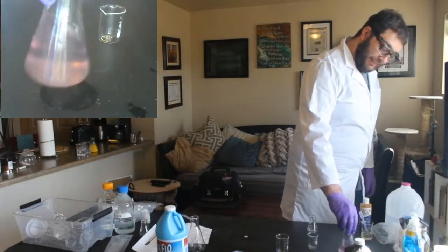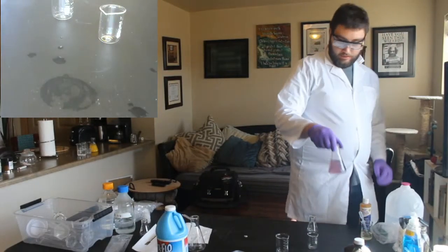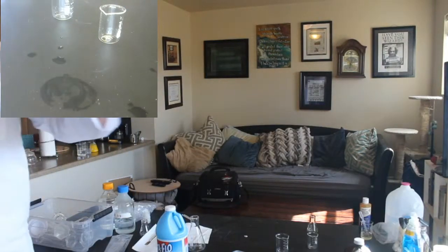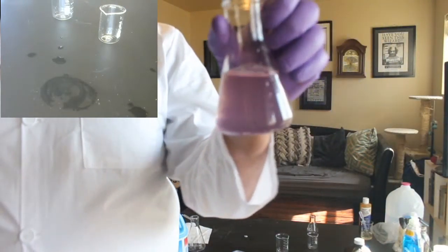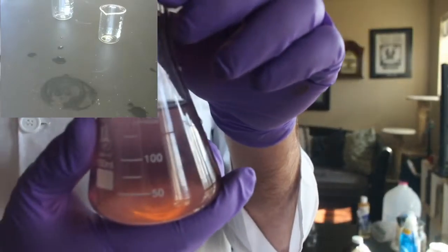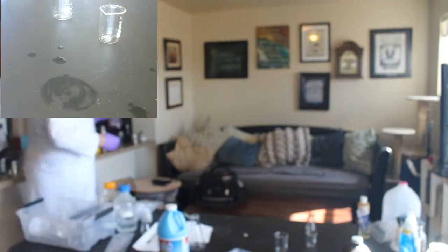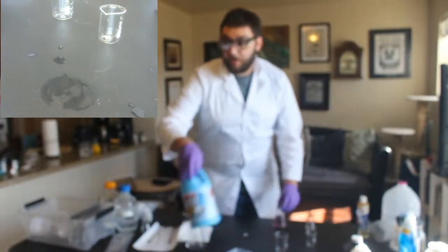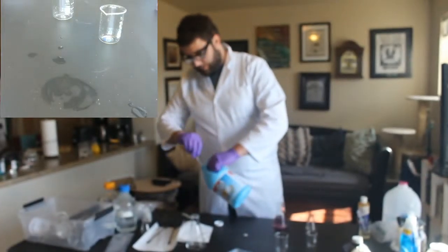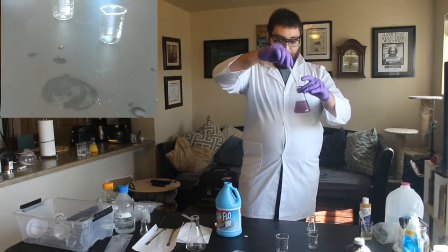So, since I added less starch, it didn't get as dark, right? And I'll do another close-up just for a comparison on the bigger camera. So not as dark. It's more of like this pinkish color. Purple. So what we can do to get it back to that really dark color is just add more starch, because that's what that iodine mixes with. So if we just add more starch.